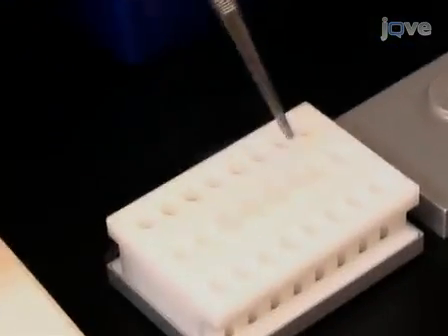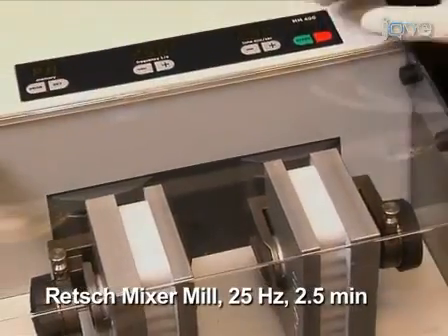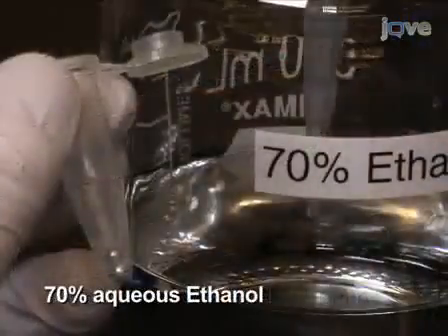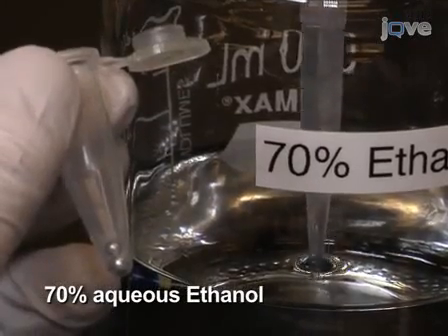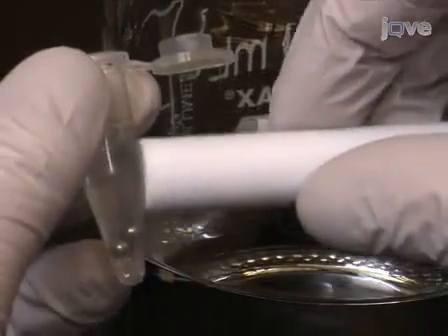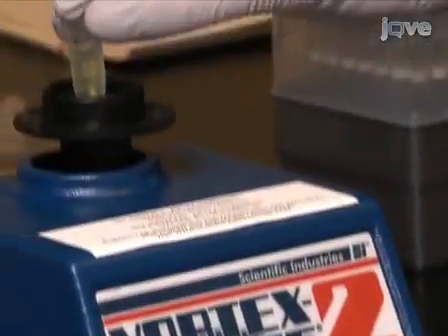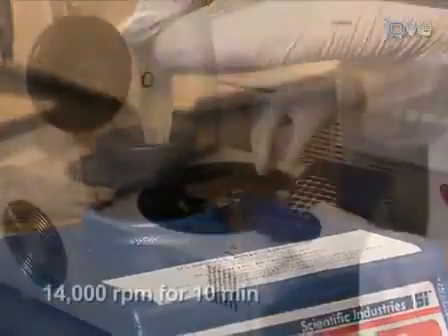Then grind the frozen sample using a ball mill for 2.5 minutes at 25 Hz. After grinding the material, add 1 milliliter of 70% aqueous ethanol to the sample. Remove the metal balls using a magnet and vortex thoroughly. This treatment solubilizes most proteins and cell organelles.